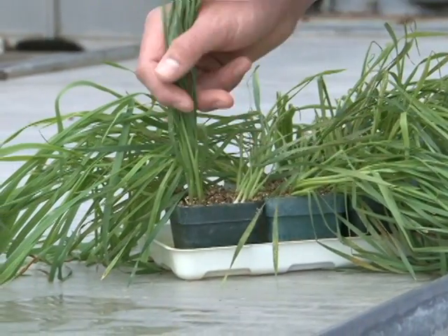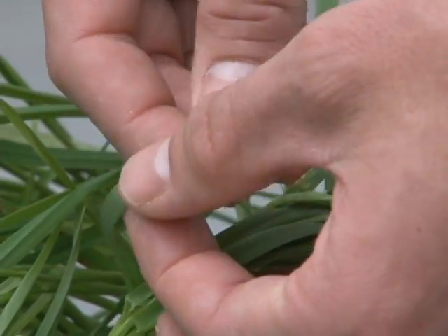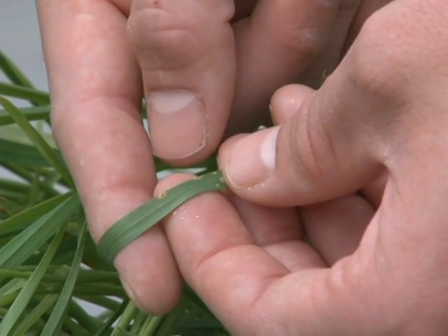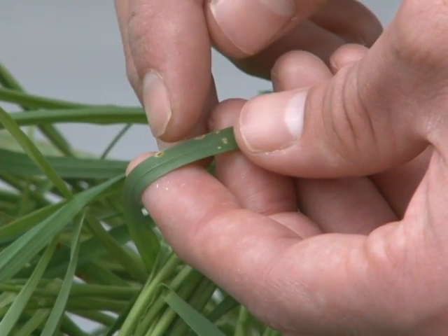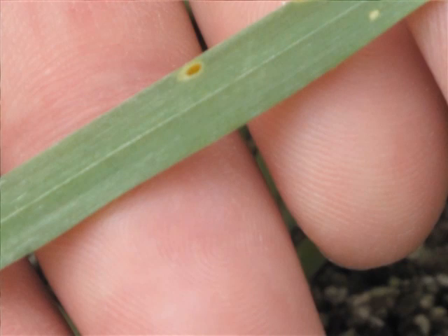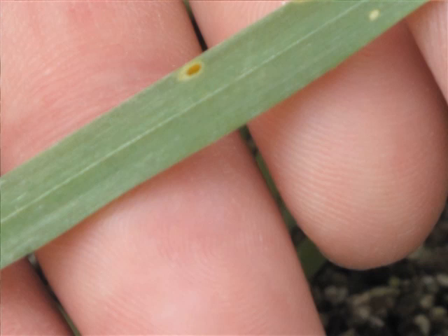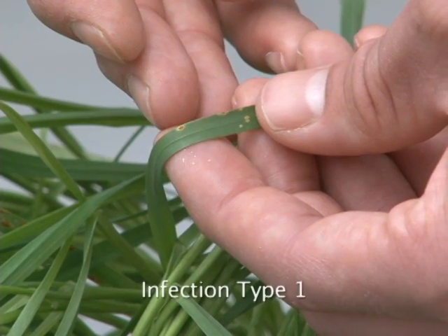This monogenic line has the gene SR38. The infection type is different than a two — there's no green island. However, you do have a sporulating area with chlorosis right around it. When you see this death of cells — chlorosis or yellowing and necrosis — right next to the sporulating area, this is indicative of a one infection type.